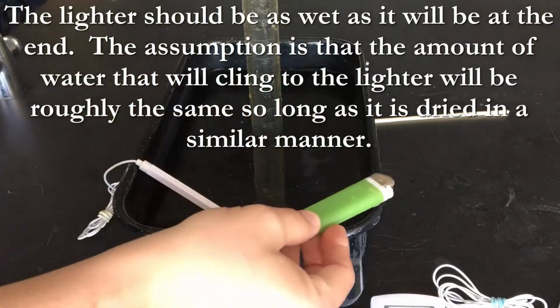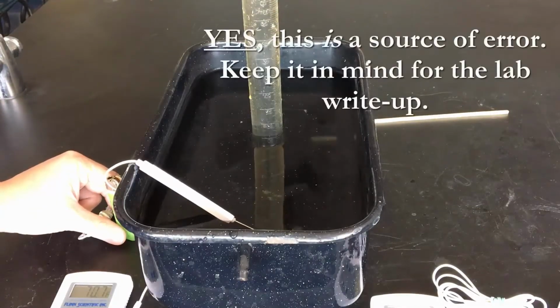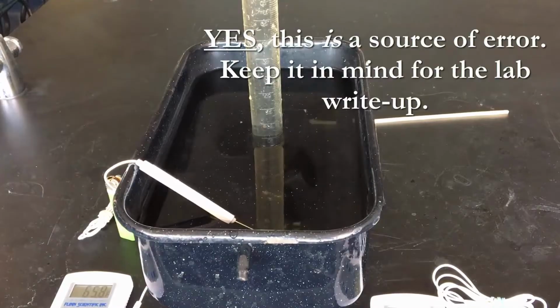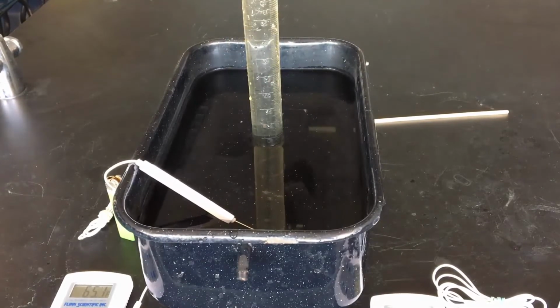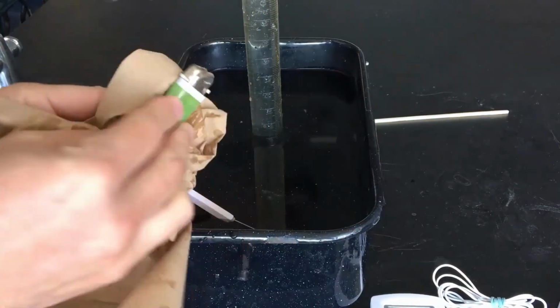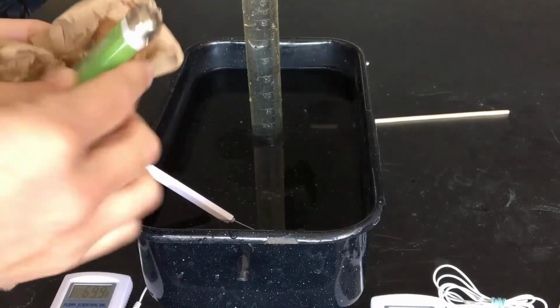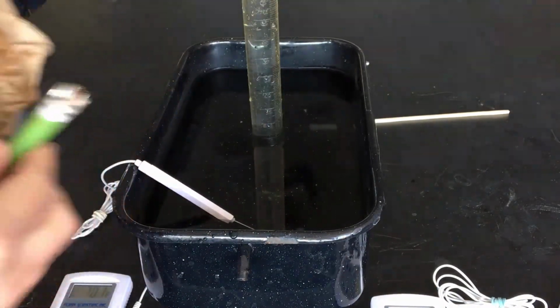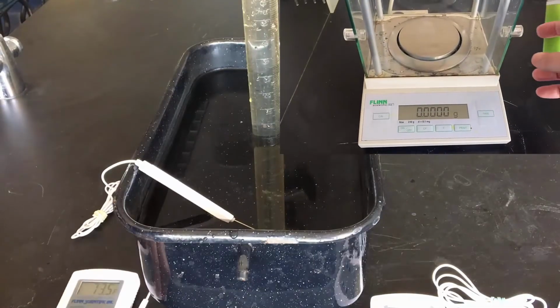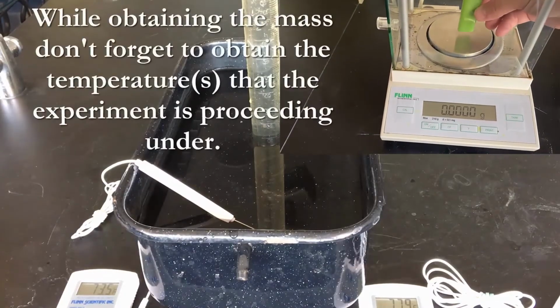The next thing is we're going to have a lighter that is damp already. Part of this keeps our students from trying to strike it and getting it to catch fire. The other is, and this is a source of error, we're going to assume that the amount of water that clings to the lighter at the beginning and at the end is roughly the same. Now, this is known to be a source of error. This is kind of a sloppy lab, but it gets the point across for students that we can at least get close to the universal gas law constant.